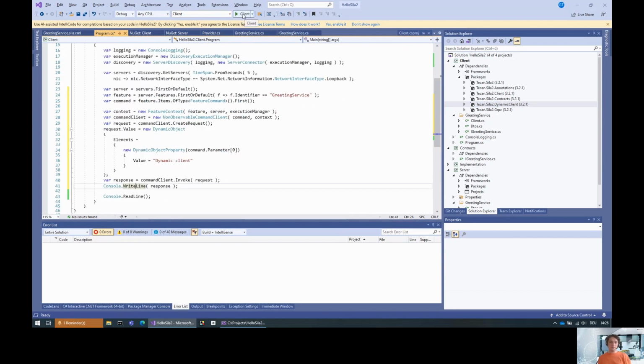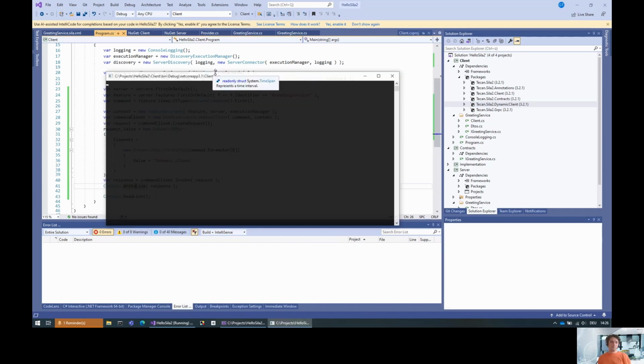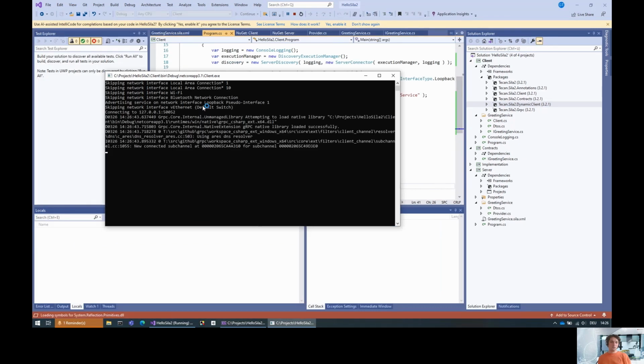So if we execute this thing, then we have a 5 second delay to query for the server. And then we have: say hello, the return value is hello dynamic client.